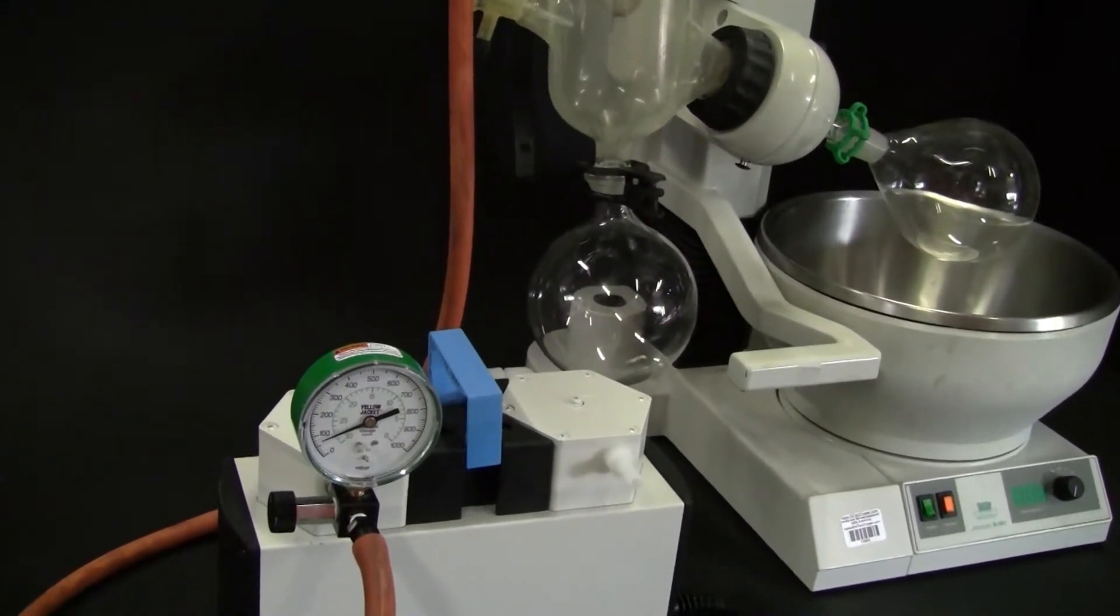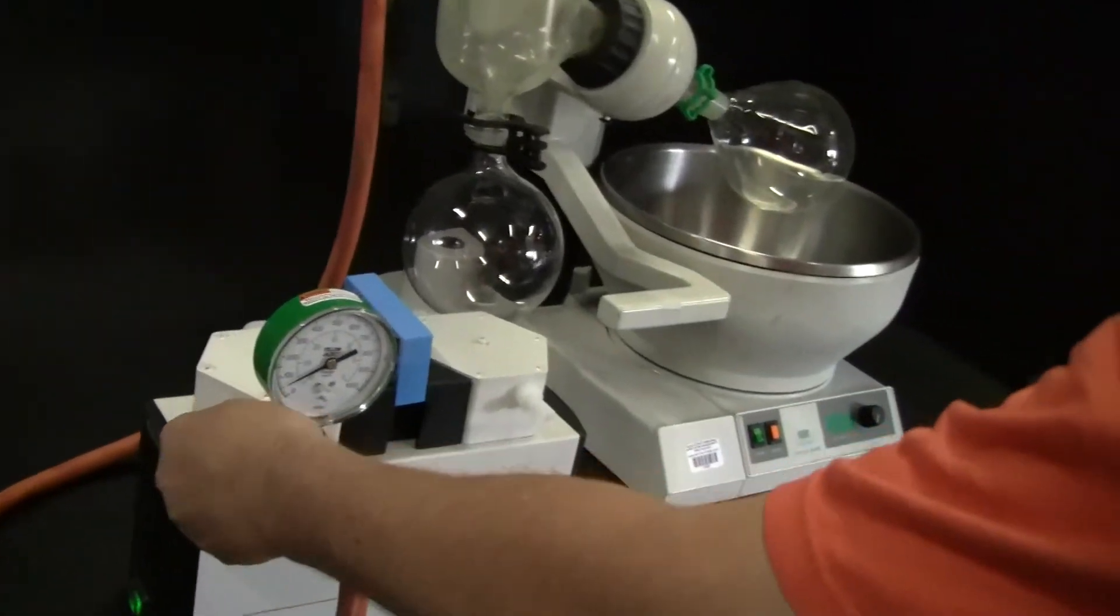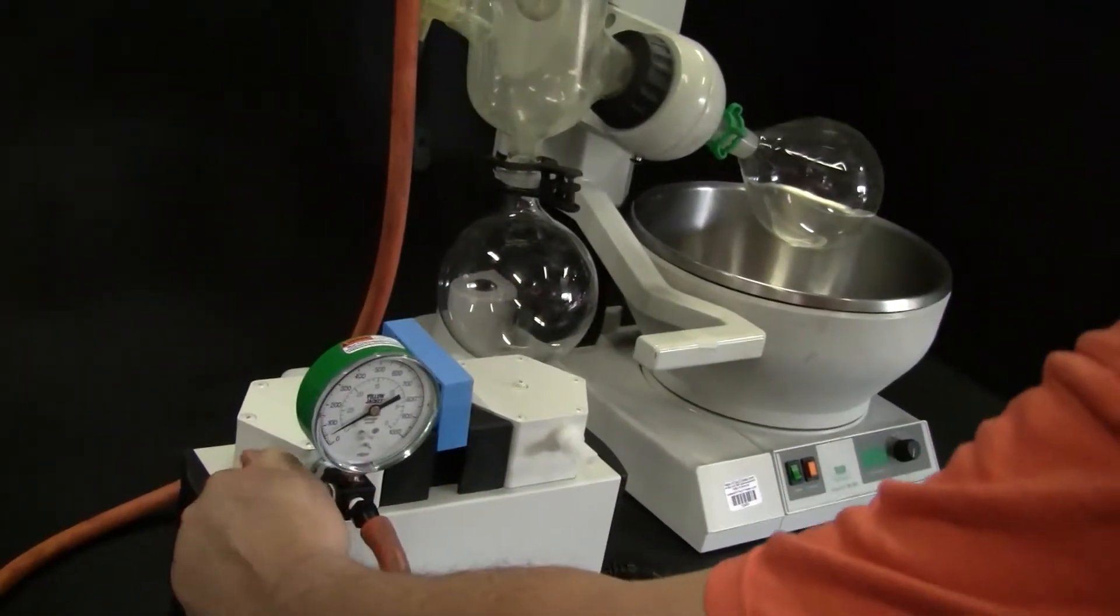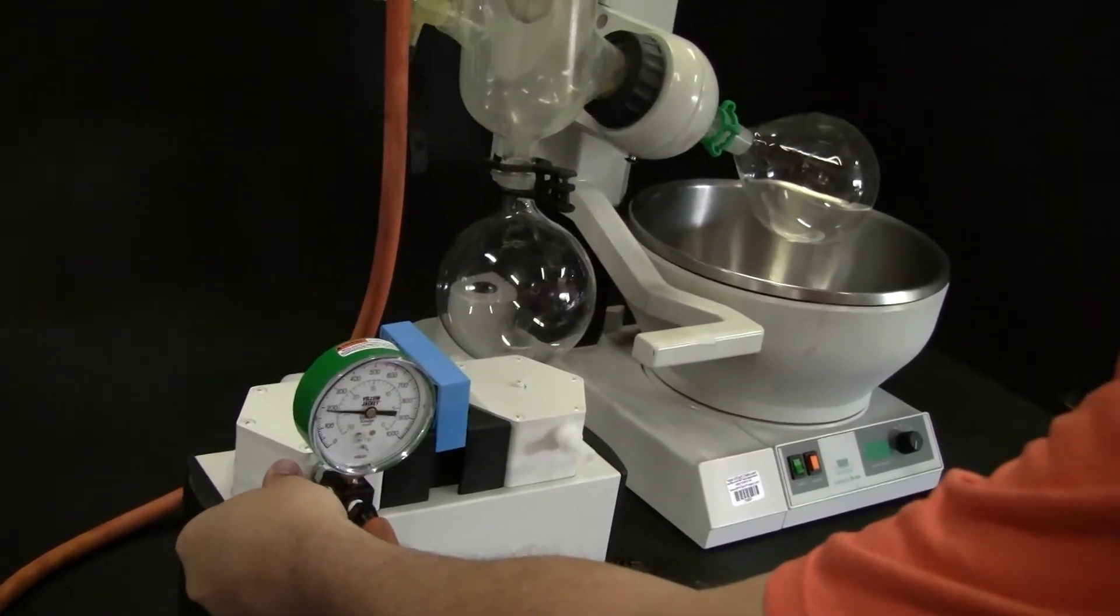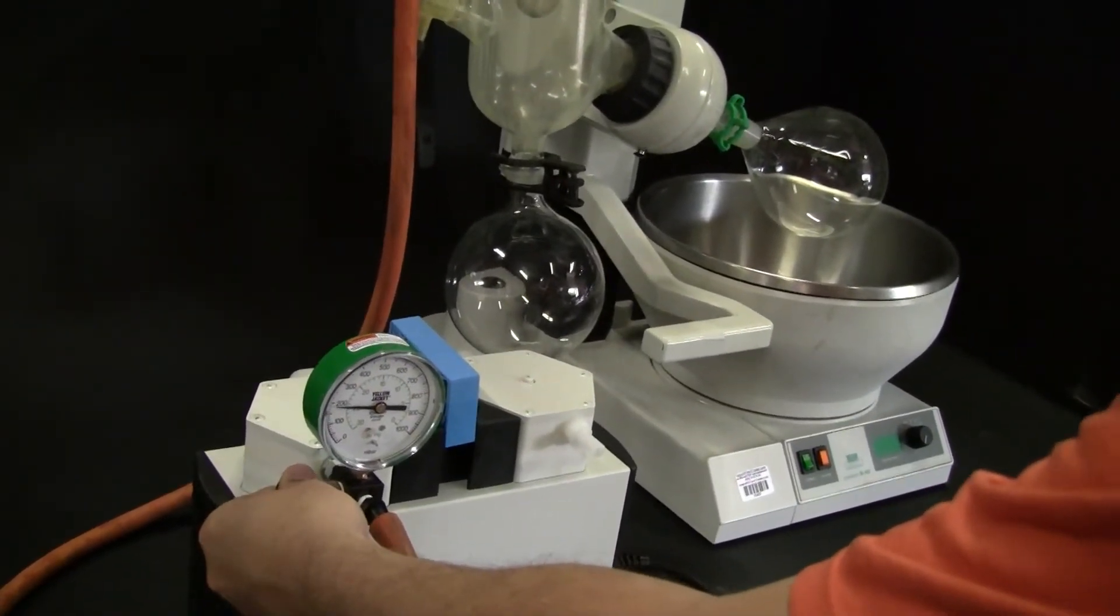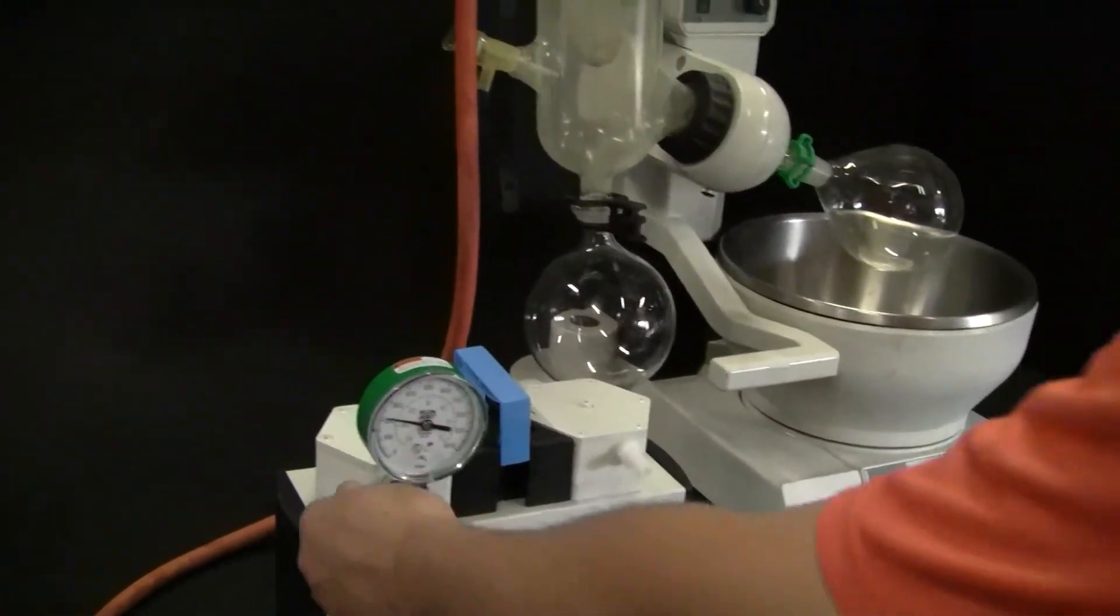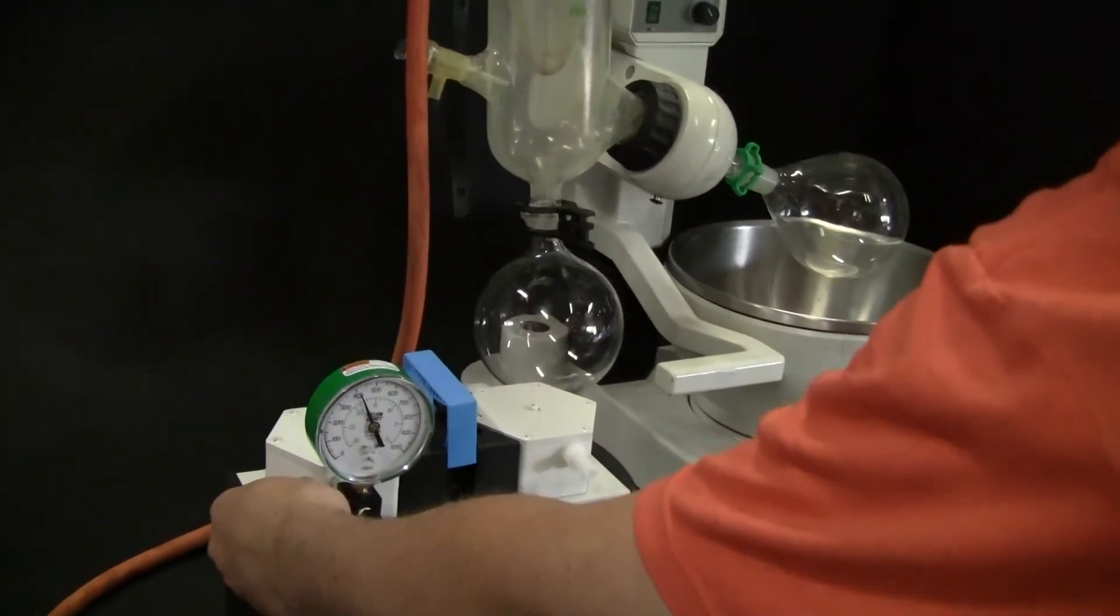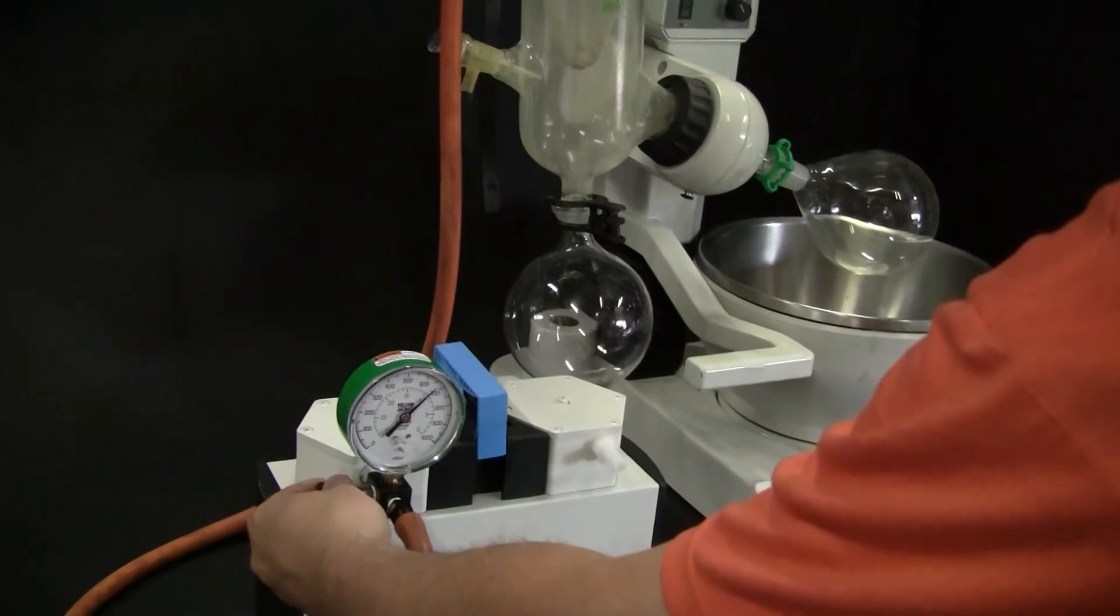And it will keep going down to full vacuum, but from there, again, I can release a little vacuum from that system and dial it right in, whether it be at the 200 millibar level or, again, releasing more at the 700.